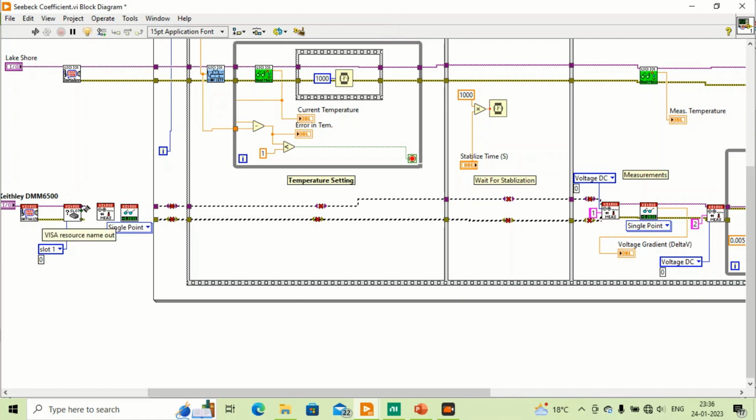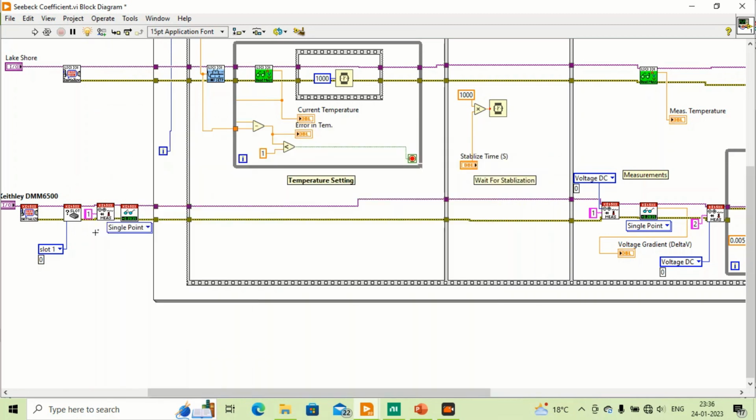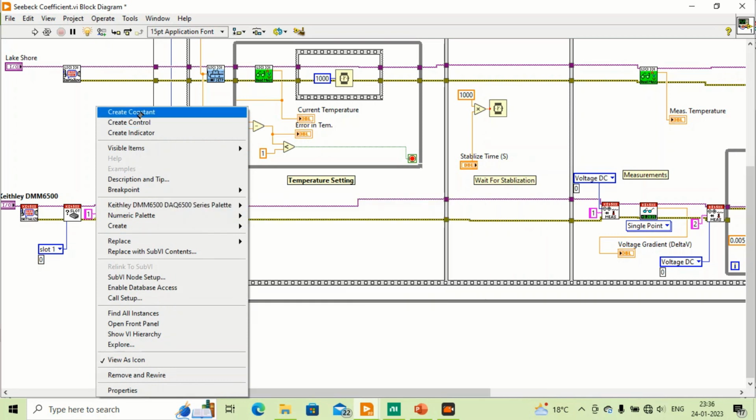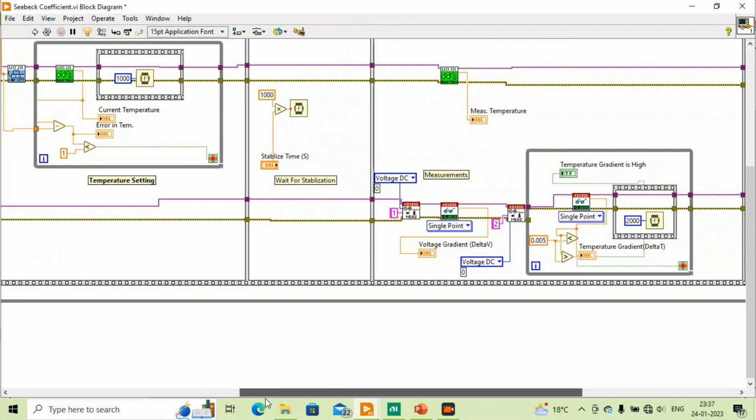Okay, so we'll connect this one. This measurement should be for channel 1, and function should be DC voltage. It's okay now. And this is, you know, offset voltage. You must have heard about this offset voltage. So we have to reduce this offset voltage every time.